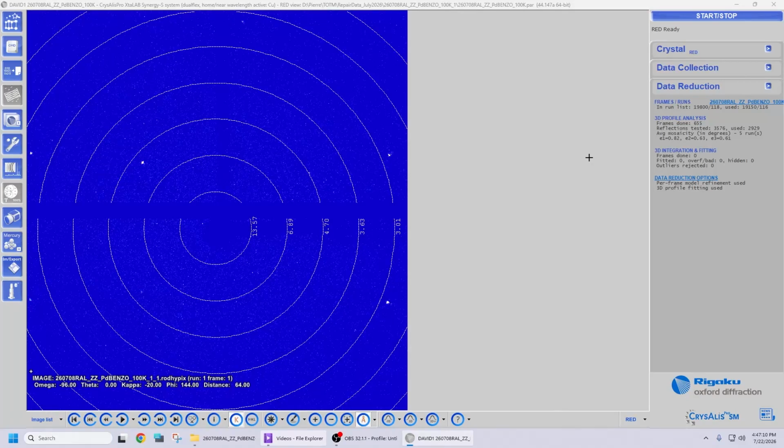Hi, this video will show you how to repair a dataset in which some of the images have become corrupted. I have here such an example that has been provided to me, where for some reason several images got randomly corrupted. For the sake of this video, I have kept only the two first scans of the dataset.